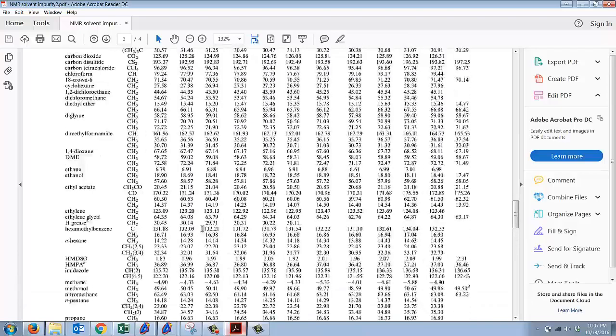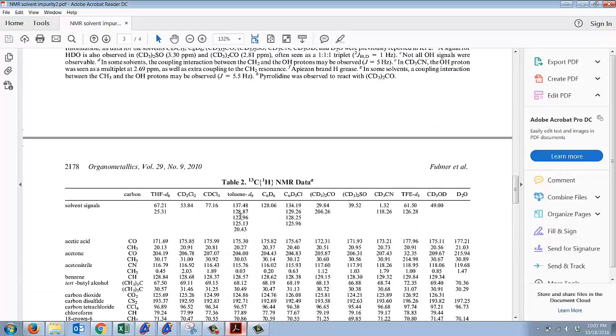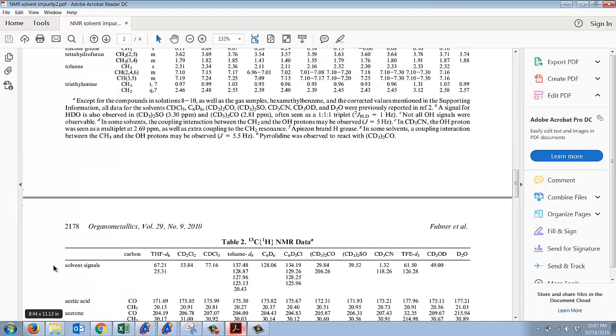And so you always want to keep this table handy. Maybe print it out and highlight the chloroform. This is very important. And just like we talked about on the NMRs, on carbon NMR, there's a peak at 77, which comes from CDCl3. And then in the DEPT, remember, there's no hydrogen on the carbon, so it doesn't show up in the DEPT.